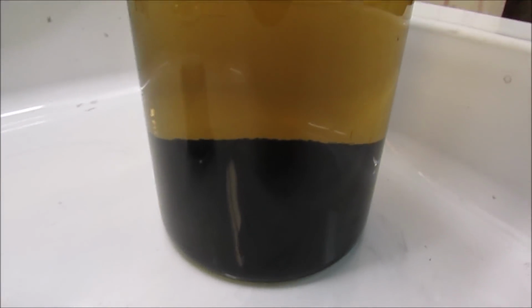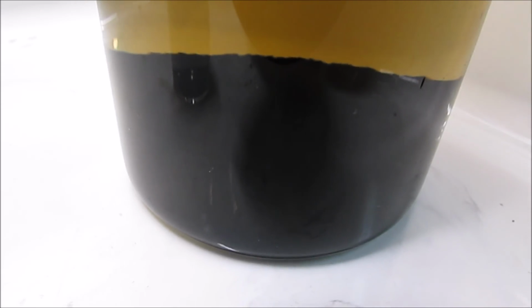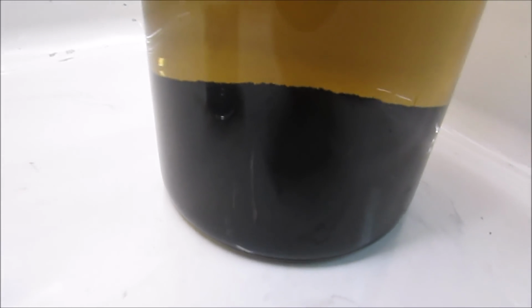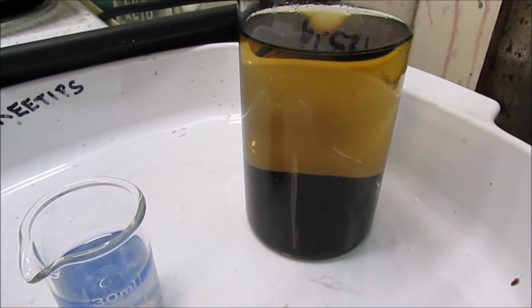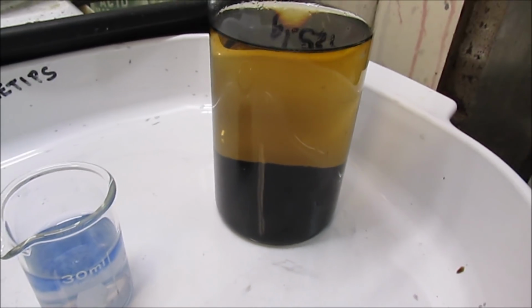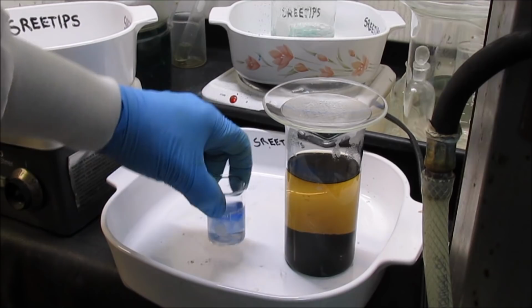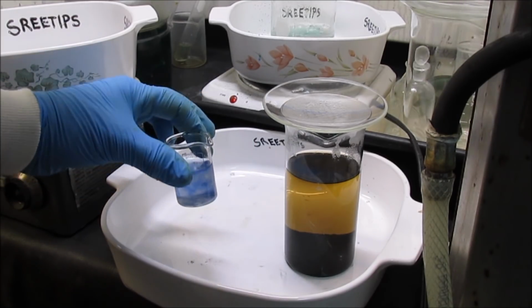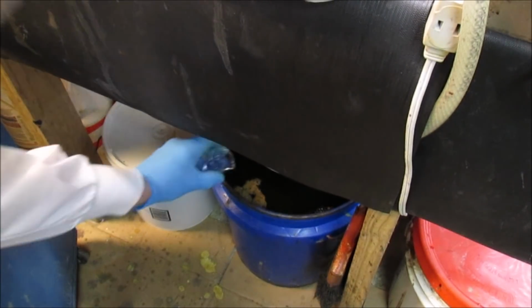Over here, the PGM powders down at the bottom of that beaker look nice and fluffy. It's settled quickly. So now what I'm going to do is decant that solution and start rinsing the black powders off. Alright, this copper solution, I'm just going to go ahead and put this down into my waste treatment bucket down here.